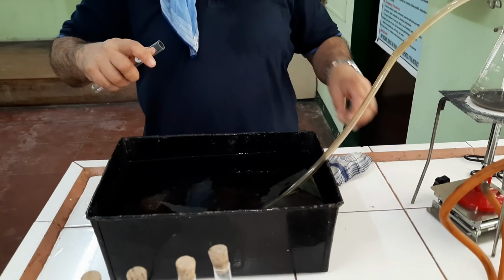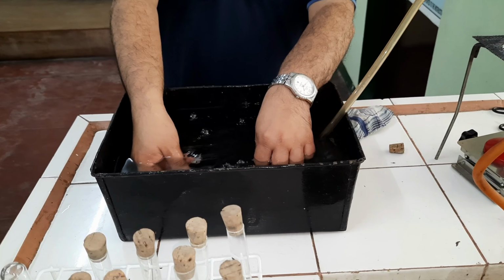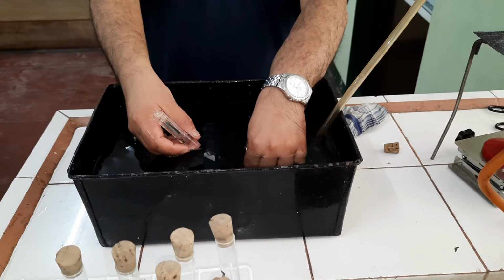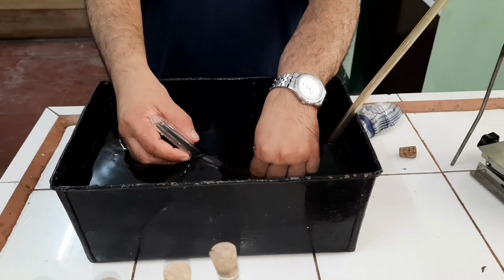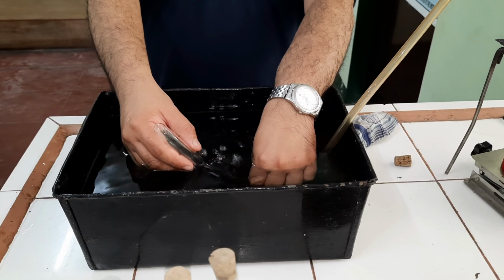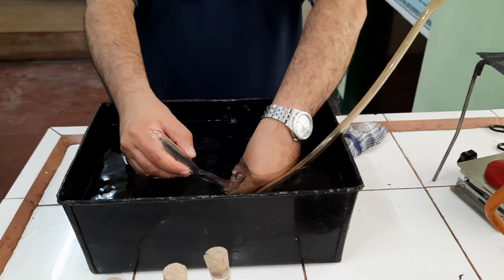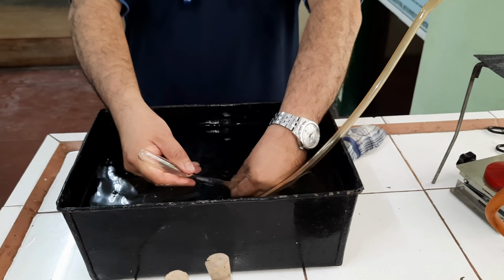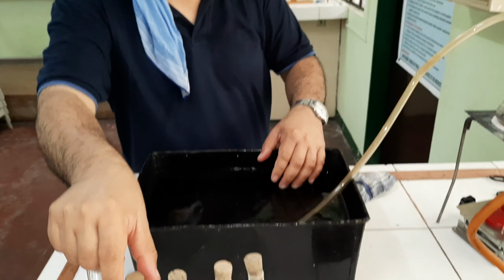Let's get another tube. Let us allow oxygen to displace the water. Focus it here now. If you could notice, the water got displaced by the gas generated from our apparatus. We'll now insert this to seal the tube. I'm inserting the cork to seal our tube. Let's collect more.